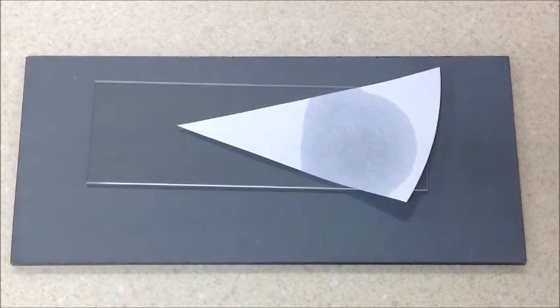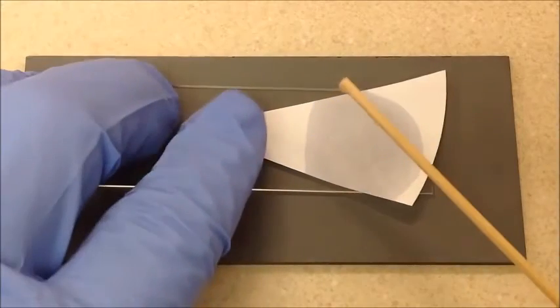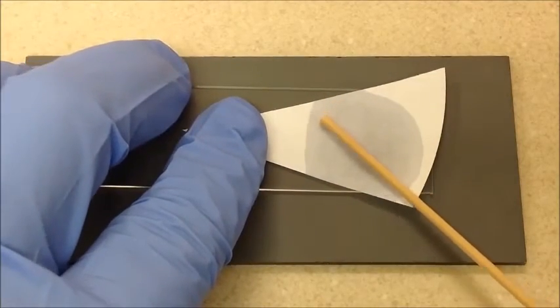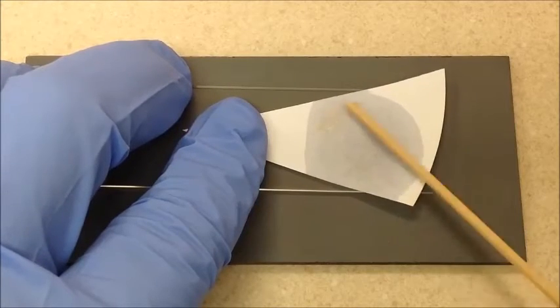Let's start with Klebsiella. Once I smear it on - I'm just using a stick - I'm going to smear a bunch on here. You have to read it within 20 seconds. If you have a positive reaction, it's usually going to be within the first 10 to 20 seconds, but it is important that you make your decision at 20 seconds.